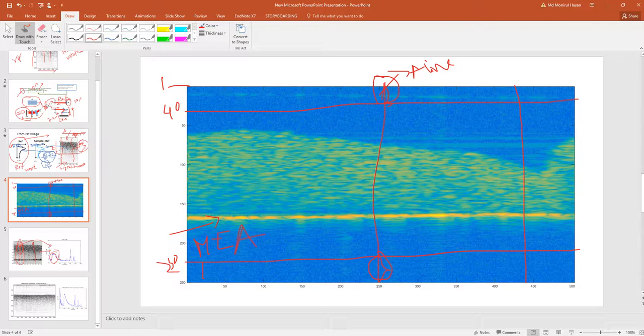And if we do it for another line, see here where there is a particle streak, in a similar way, that will be the reference noise for this particular line. Our goal is to make sure that when there is no tissue, there should not be any noise. Ideally, after subtraction of noise, the SNR of the part with no tissue should be 0, and when there is tissue, there should be a certain amount of SNR, whatever it is.